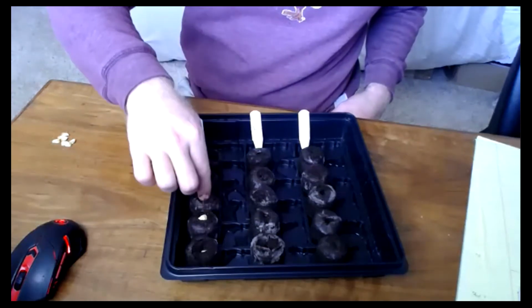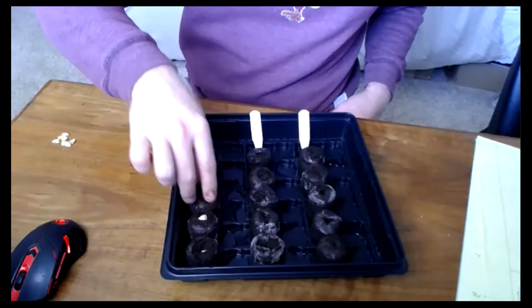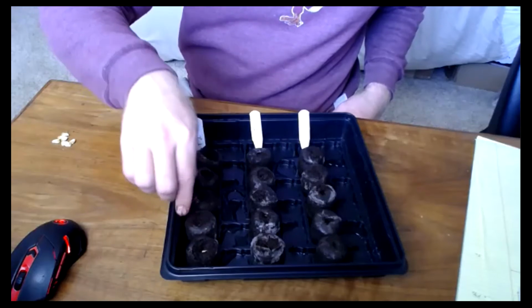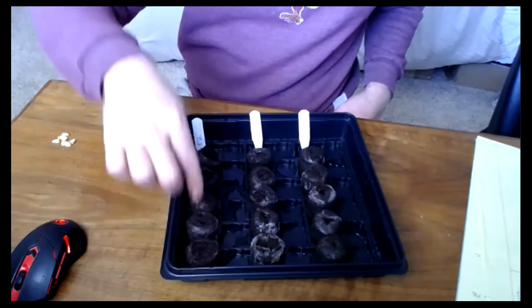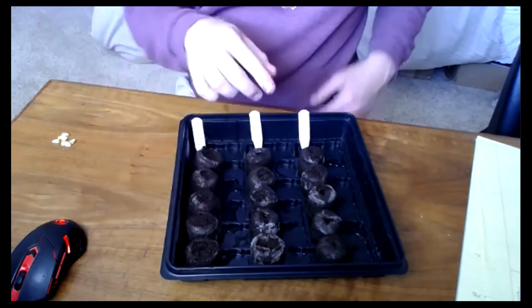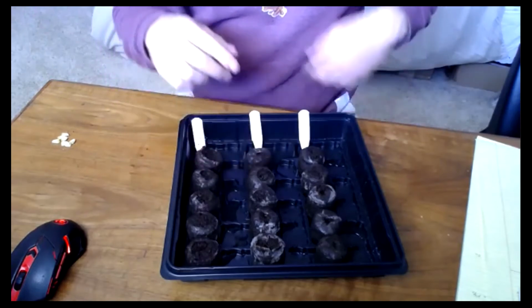And these peat pots hold water very, very well, which is pretty beneficial for what we're doing. Make sure those seeds get planted so they're set up for good emergence, good germination. I like to cover them a little bit with the peat that's in there. All right, now we're going to do the same thing for treatment 3.